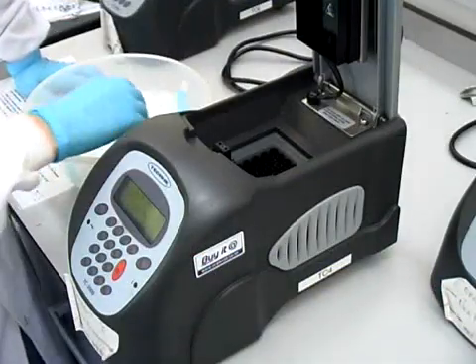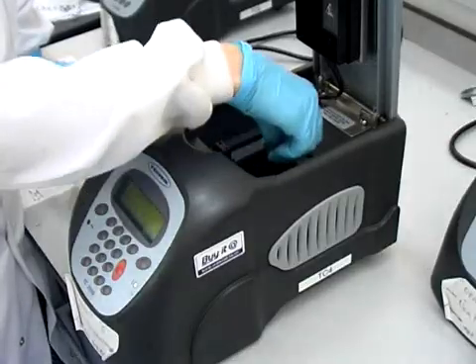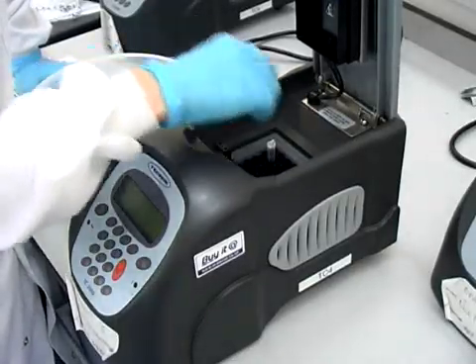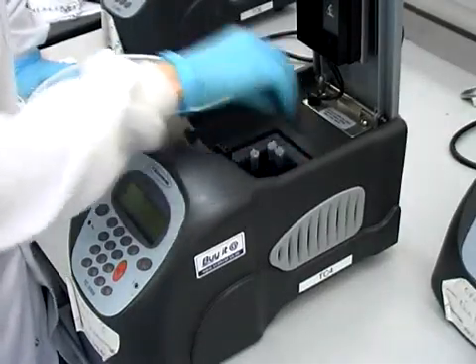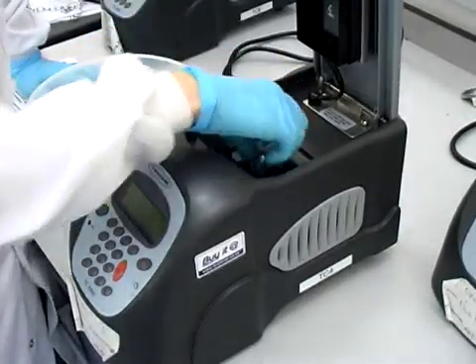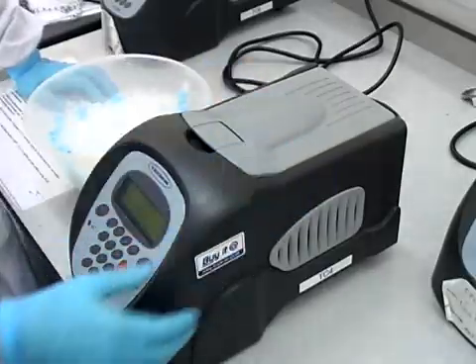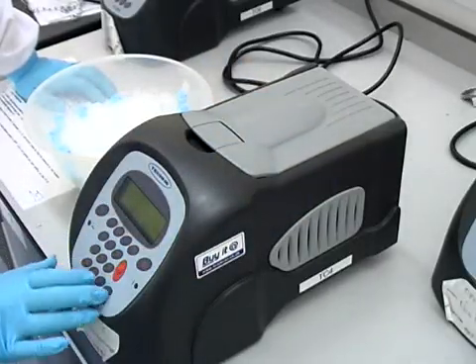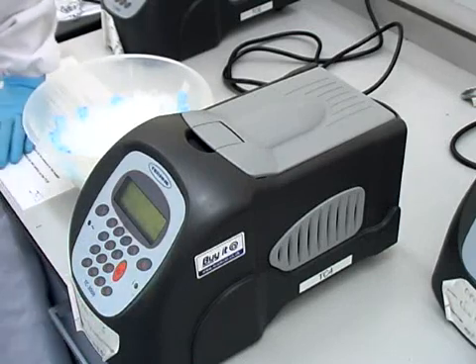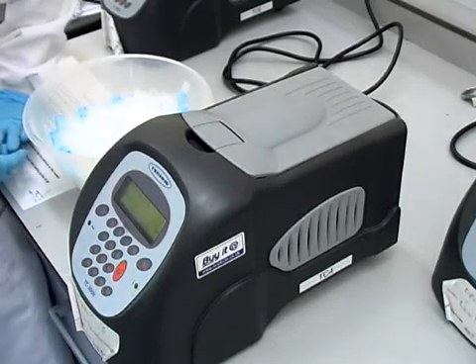Once the samples are prepared they are then placed in the thermocycler. The lid is closed and the cycle is started. And the cycler is pre-programmed to reach certain temperature for a certain period of time.